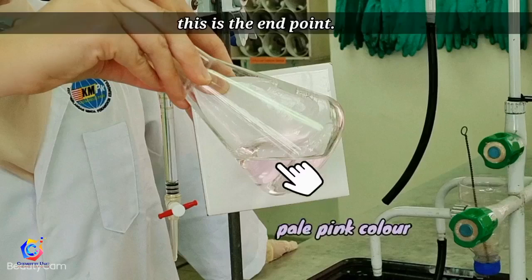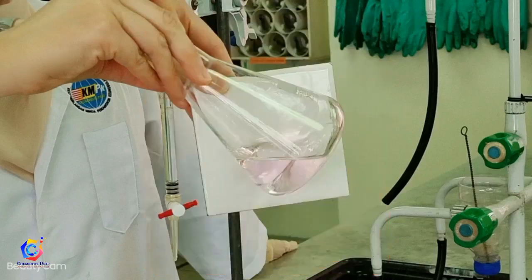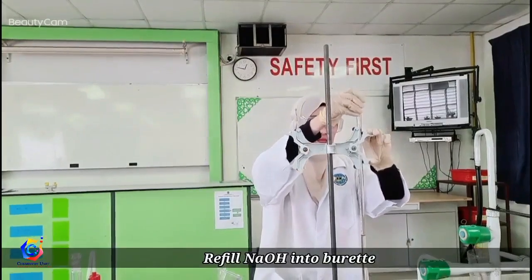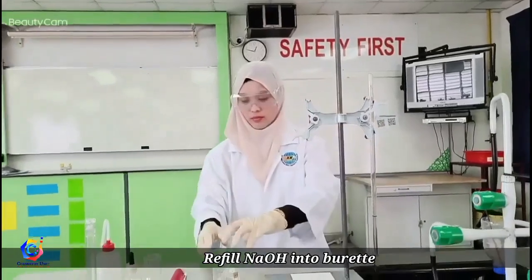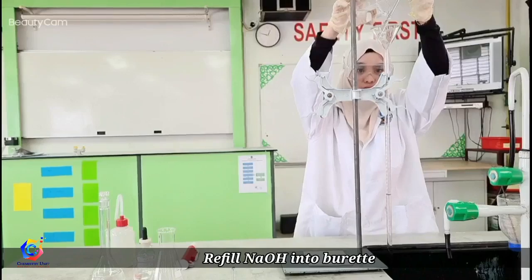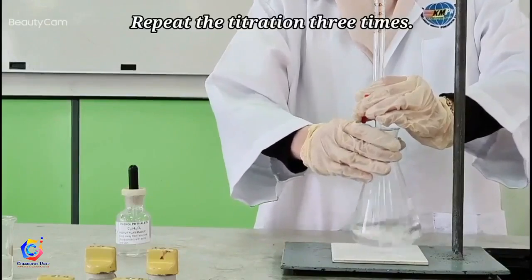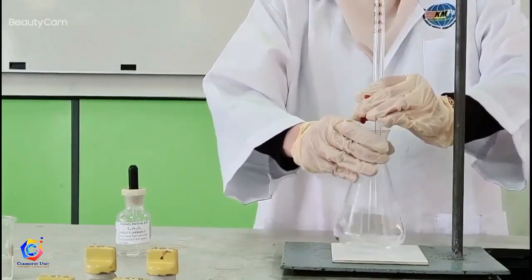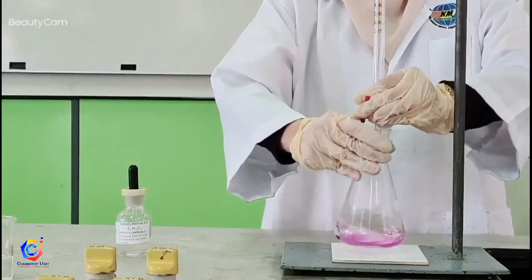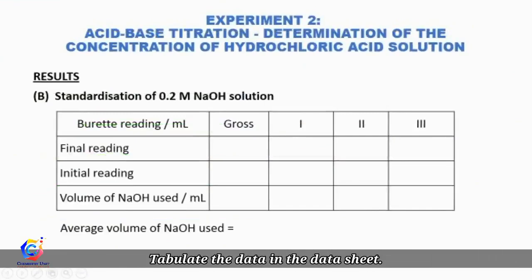Record the final burette reading to two decimal places. Refill your NaOH into the burette to continue with the next titration. Repeat the whole process three times. Tabulate the data in the data sheet and calculate the molarity of the NaOH solution.